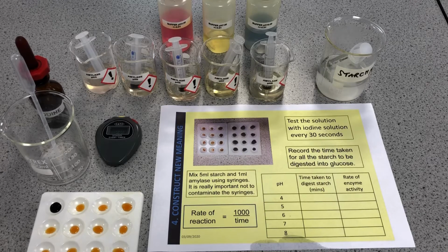Now, as we know, enzymes in the stomach work well in acidic conditions. Enzymes in the small intestine work well in alkali conditions. So what we're doing is we're actually looking at amylase, which, if you remember, works in the mouth. It comes from the salivary gland as well as other places. And we talked about that chewing of the bread and the starch being broken into glucose and then being able to taste that. And what we're looking at is what pH would be the best pH to have in the mouth for amylase from the saliva to be really, really effective at breaking down starch into sugar.